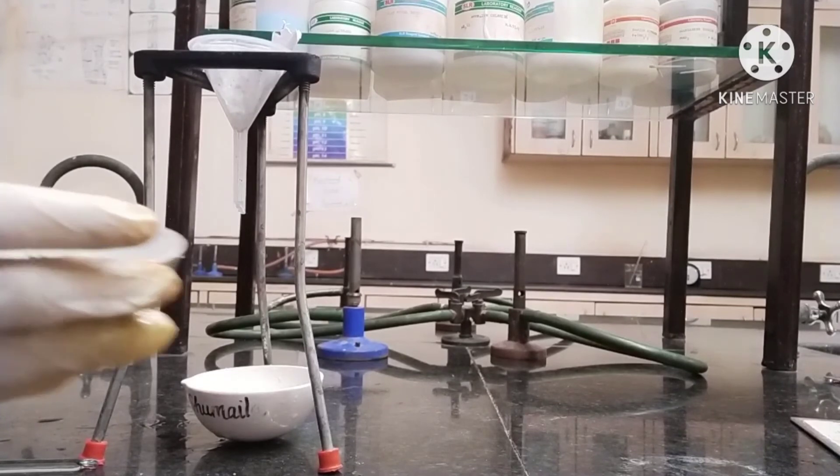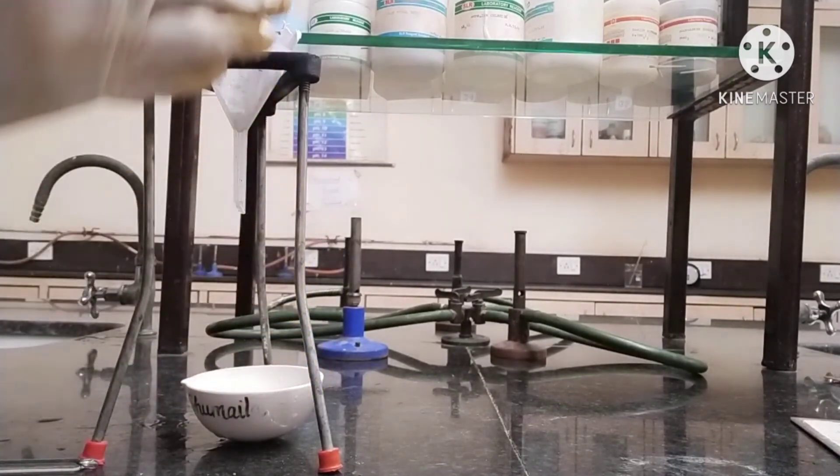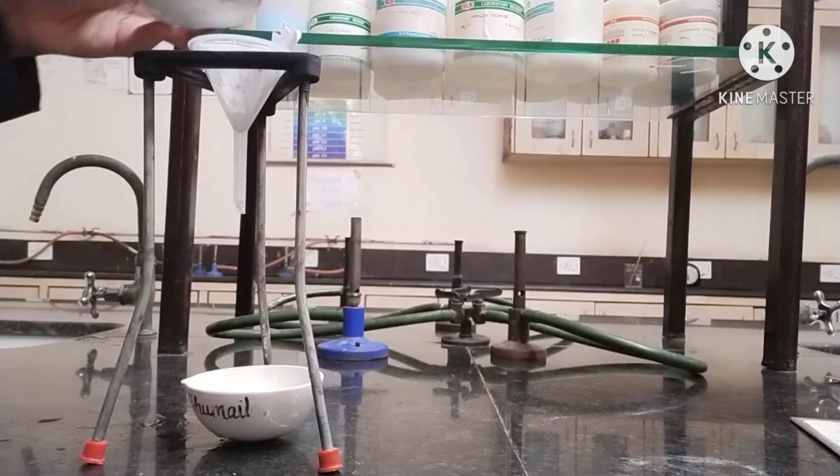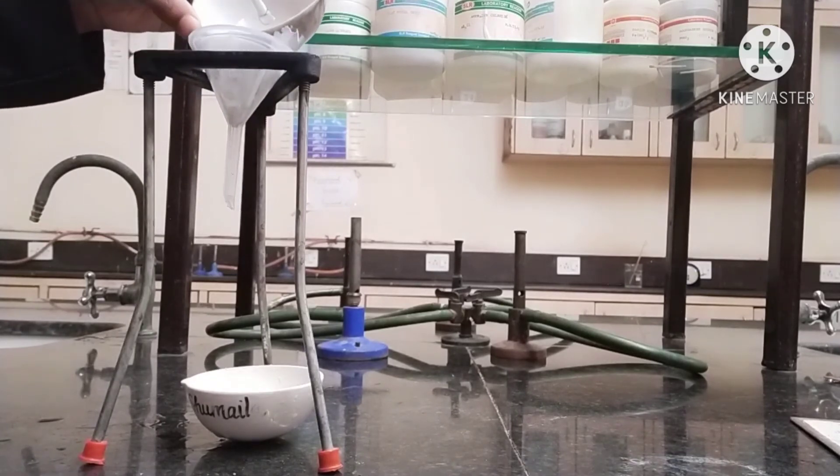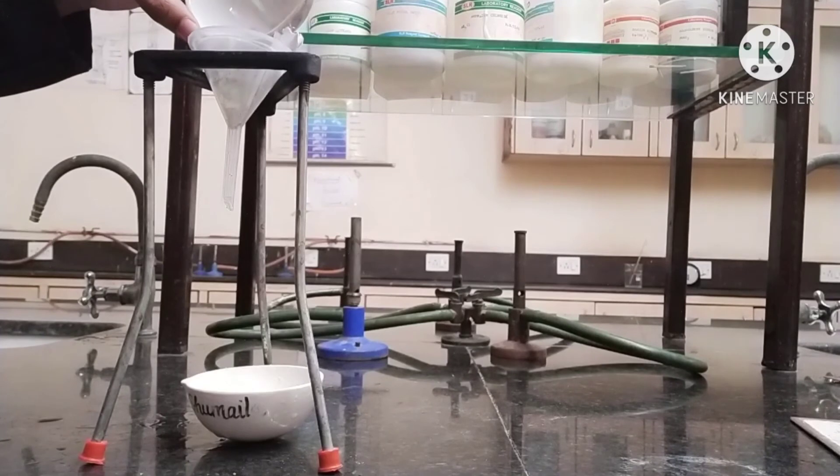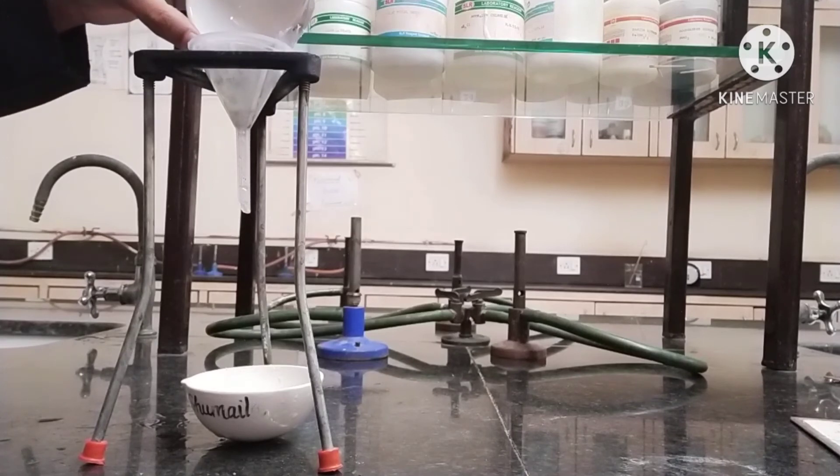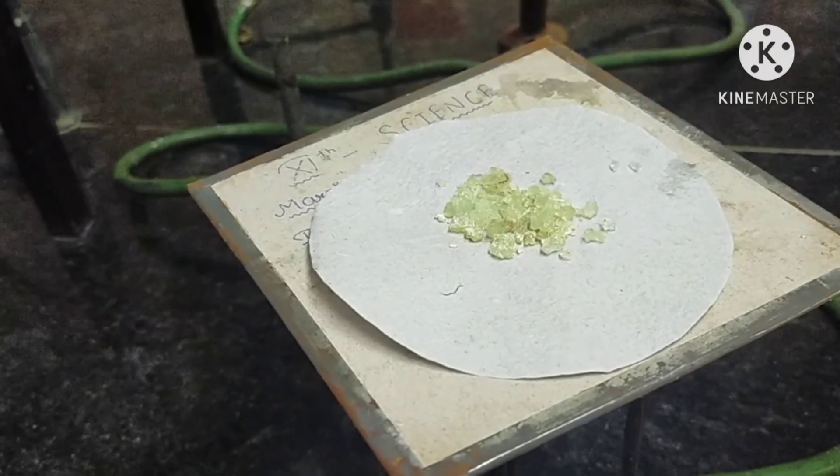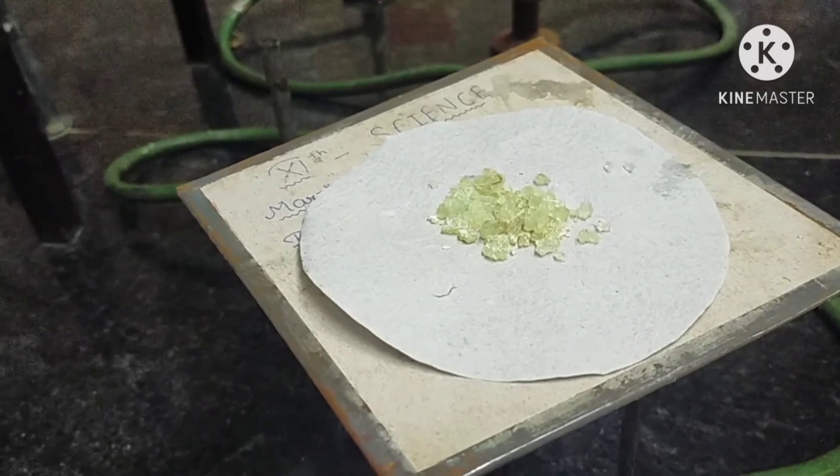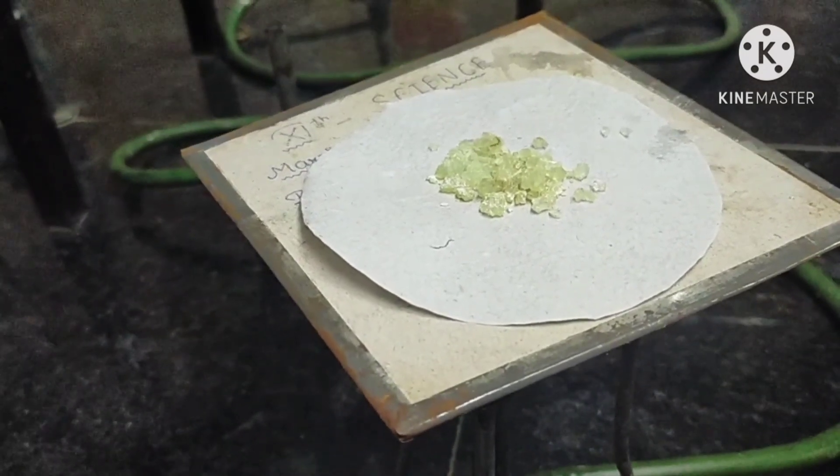Now filter these crystals like this. Filter the crystals and then dry these crystals over the burner like this.